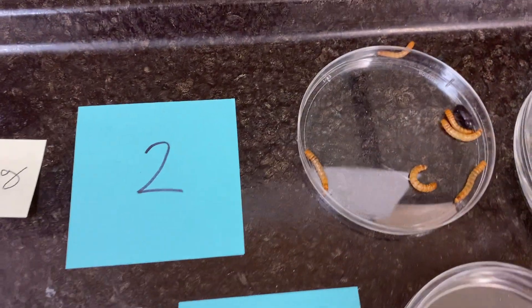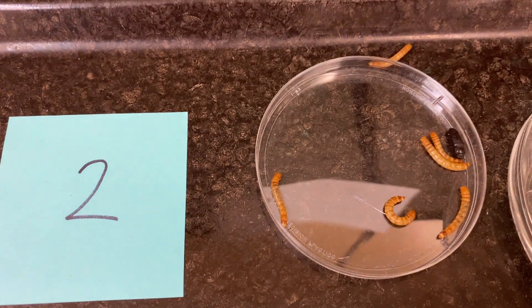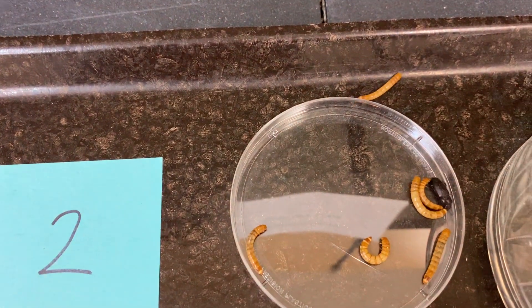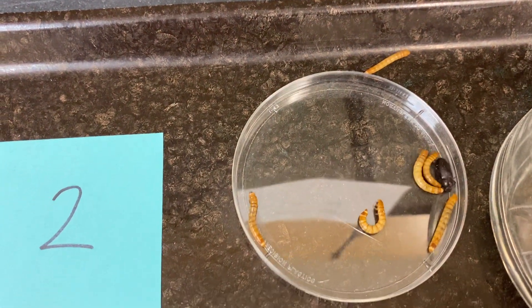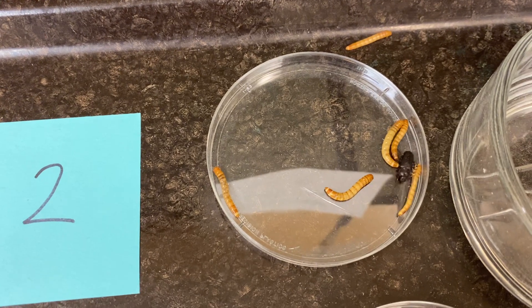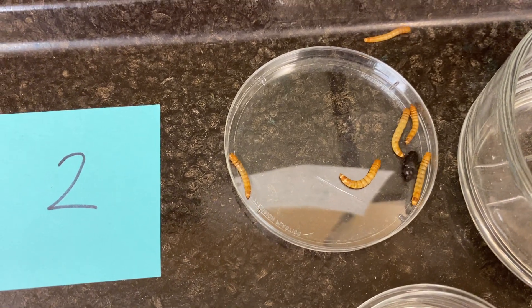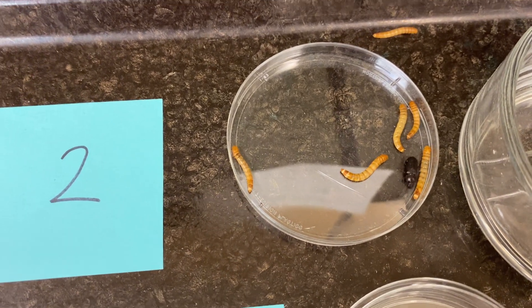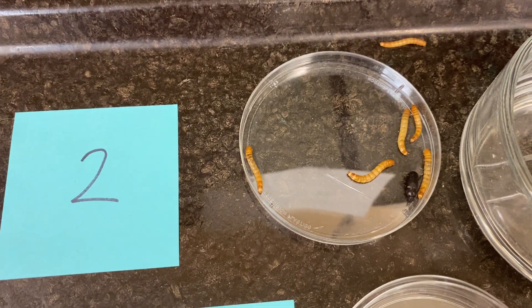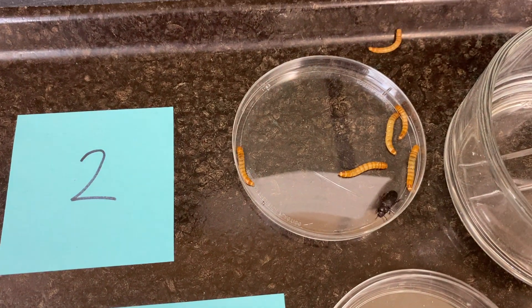For treatment number two — one of them escaped up top but we're still going to count him. We have a total of seven organisms, including one adult beetle. Again, don't count mealworms and beetles separately — just take notice of that and record the total.